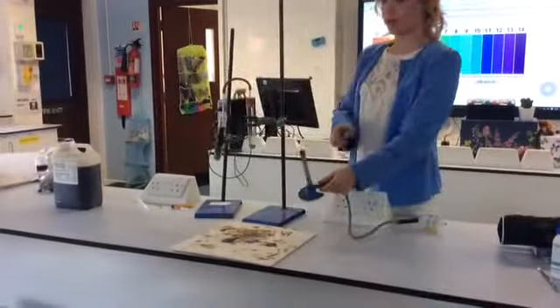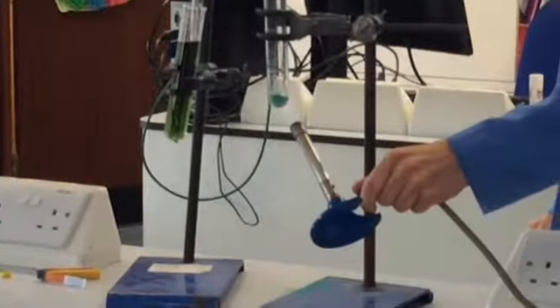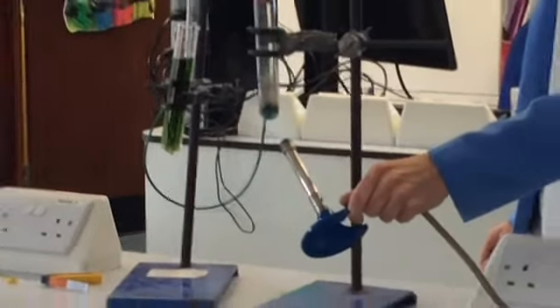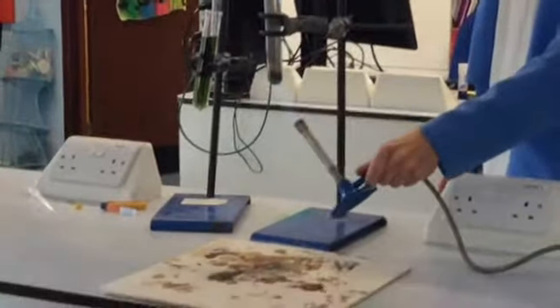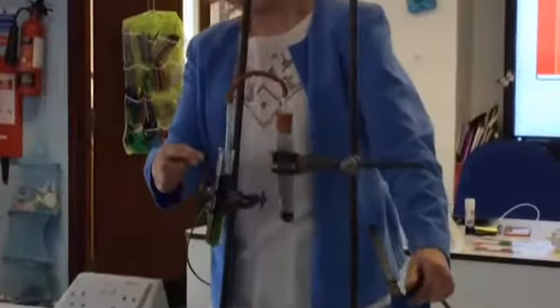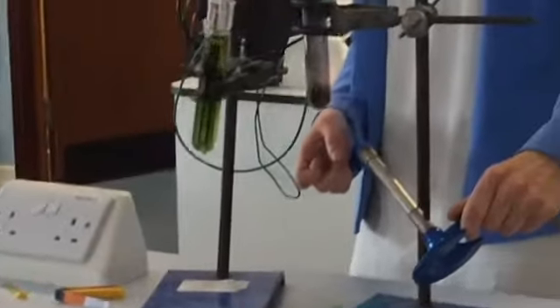Now I'm going to use the Bunsen burner on the hot flame, and I'm going to use the top of the blue cone to heat my copper carbonate and form carbon dioxide. So you can see the compound is breaking down really quickly, and you can see that there's some gas forming, and it will start to bubble out here in a minute. You can actually also see that the copper carbonate has turned black, and that's because it's broken down into a different compound, copper oxide, which is black.